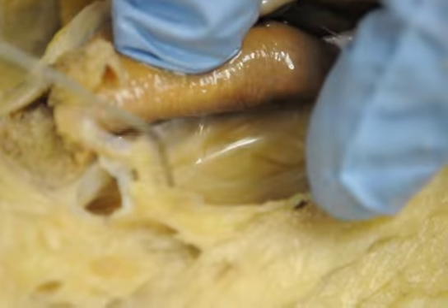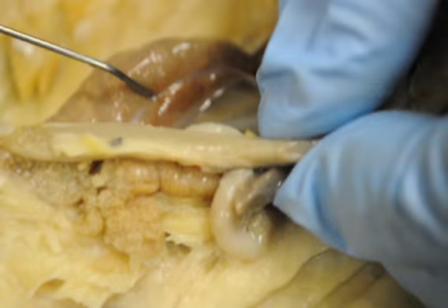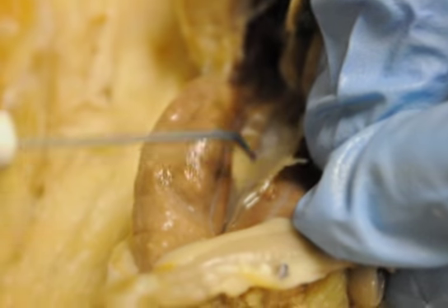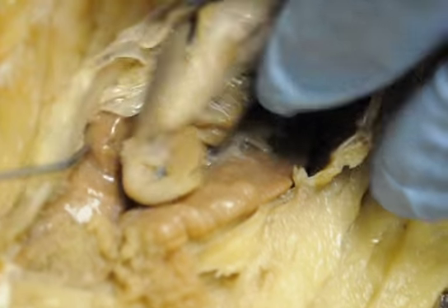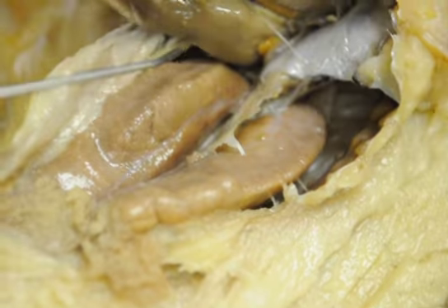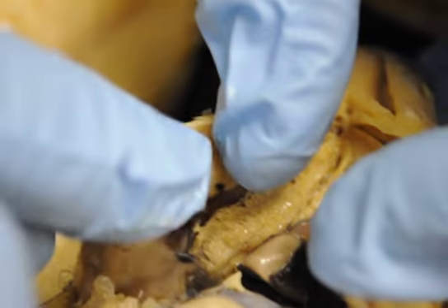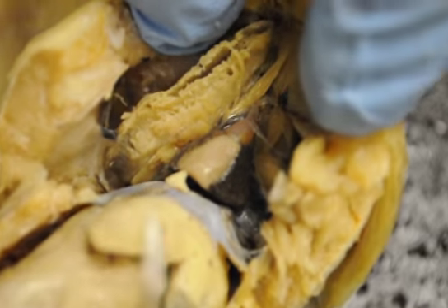And then of course we have, let's see if we can find it back under here. Okay. Now then, again, there's part of the stomach and small intestines. Now let's go up here to the pericardial cavity where the heart lies. When we get inside the pericardial cavity, we see the heart located right here.